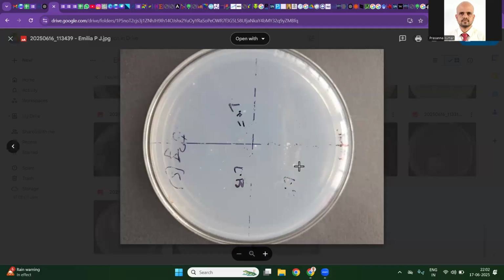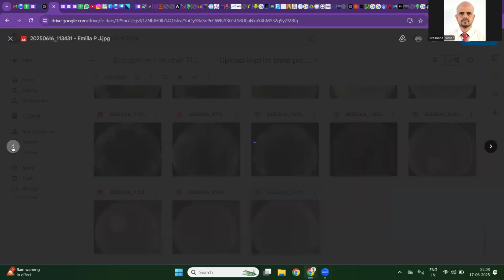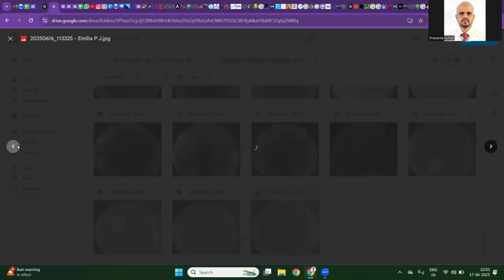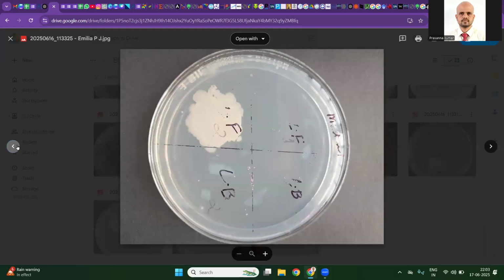All right, we will see one by one. In this plate, we have a swarming Bacillus here. For this imprint region, we have to check the corresponding region in the inoculated plate for contamination. Even though it looks clean, we have one more colony here and one more colony here. So we may have to rethink again.